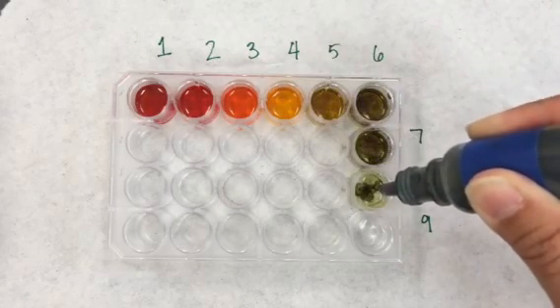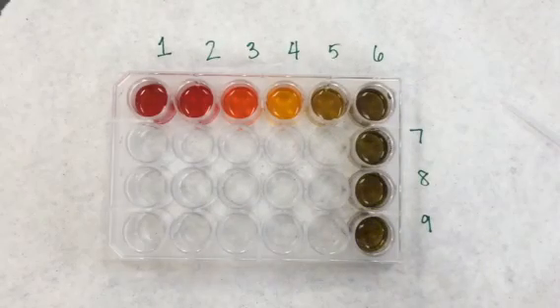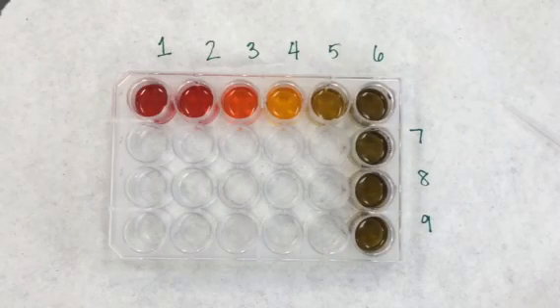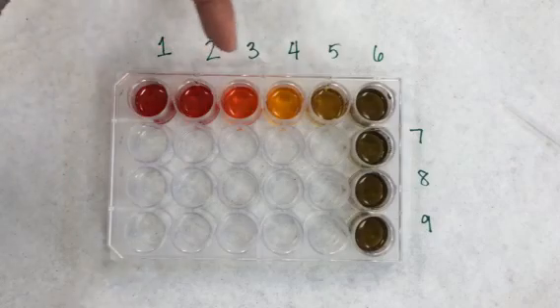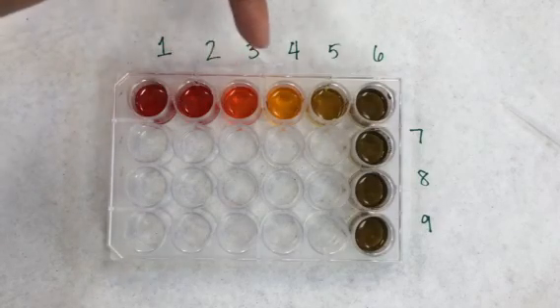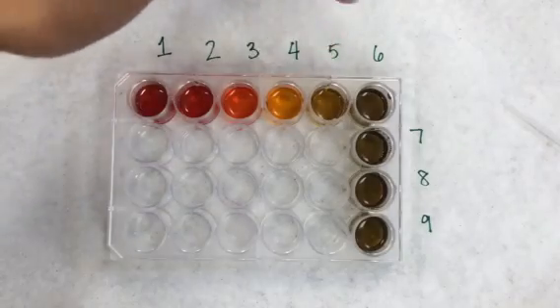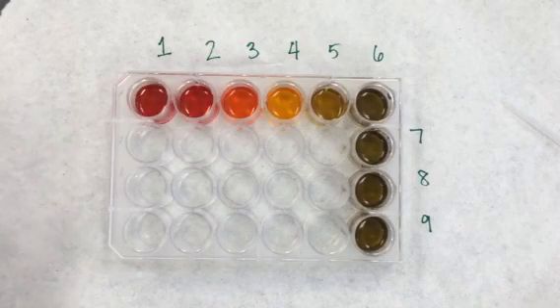So this particular universal indicator is specifically for acids. It has a better sensitivity in the 1 to 7 pH range. So we can see that the 1 molar hydrochloric acid solution has the deepest red shade, and as we diluted, the color of the indicator began to change. So we have another red, and it transitions from orange to yellow to kind of a light green, and then from about 6 through 9 they pretty much look the same.